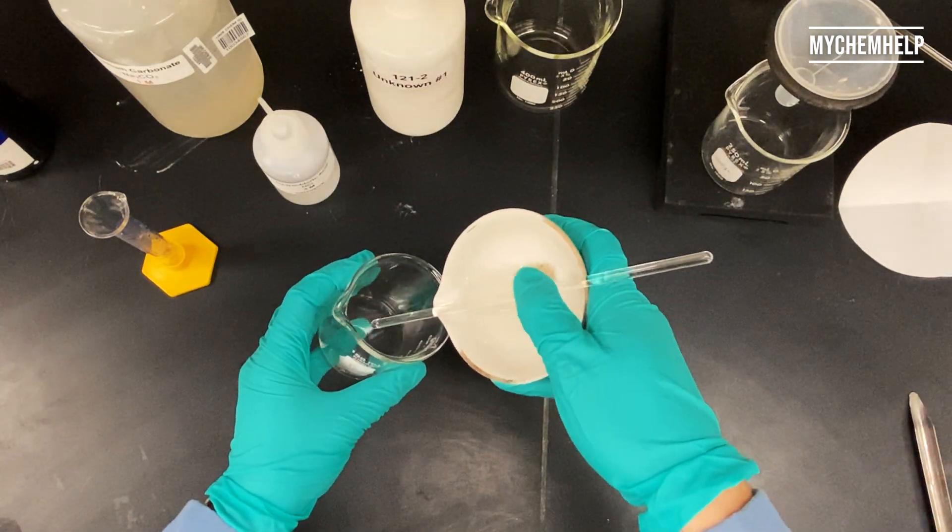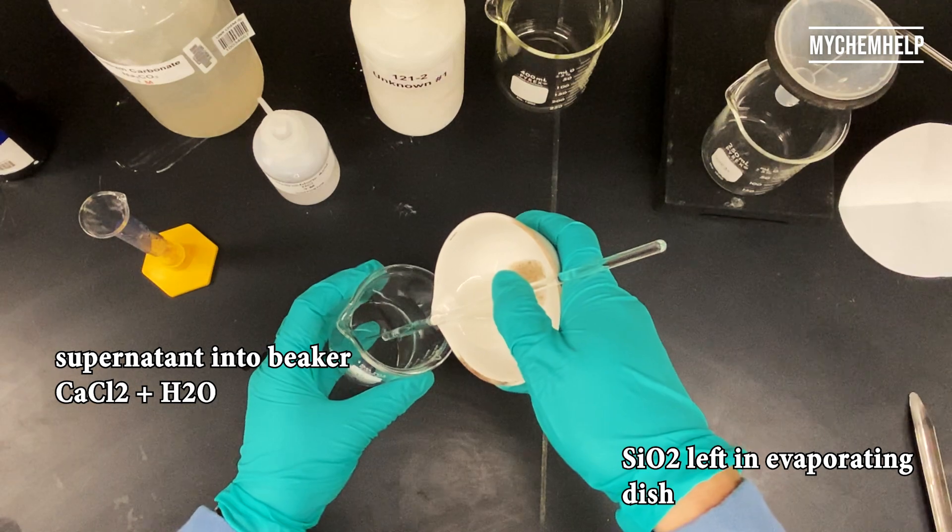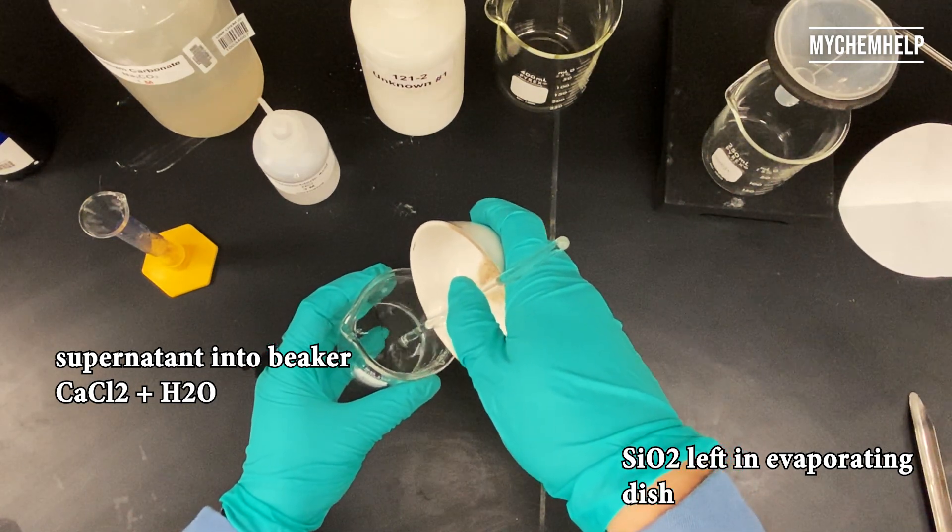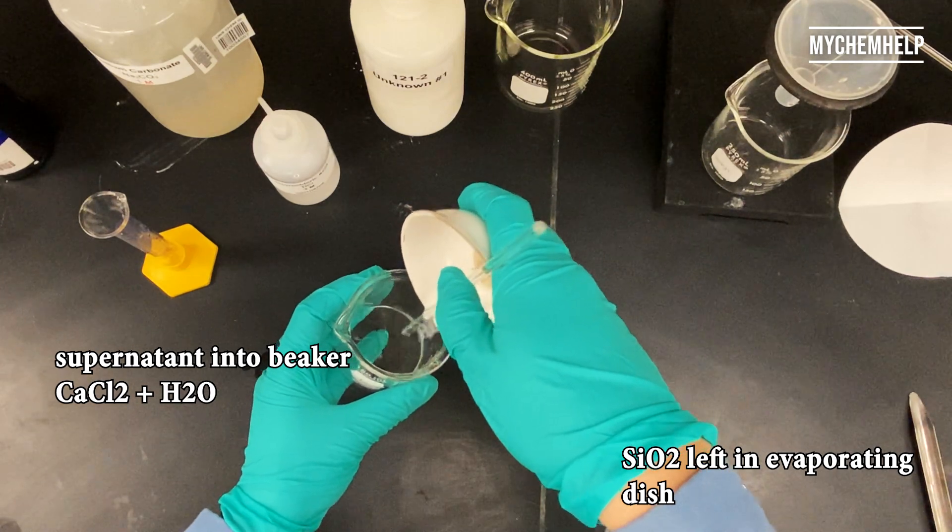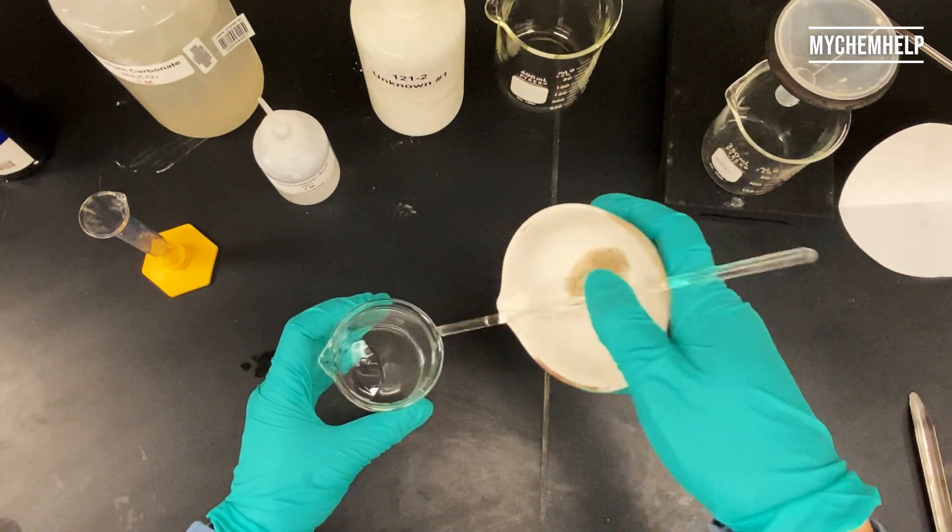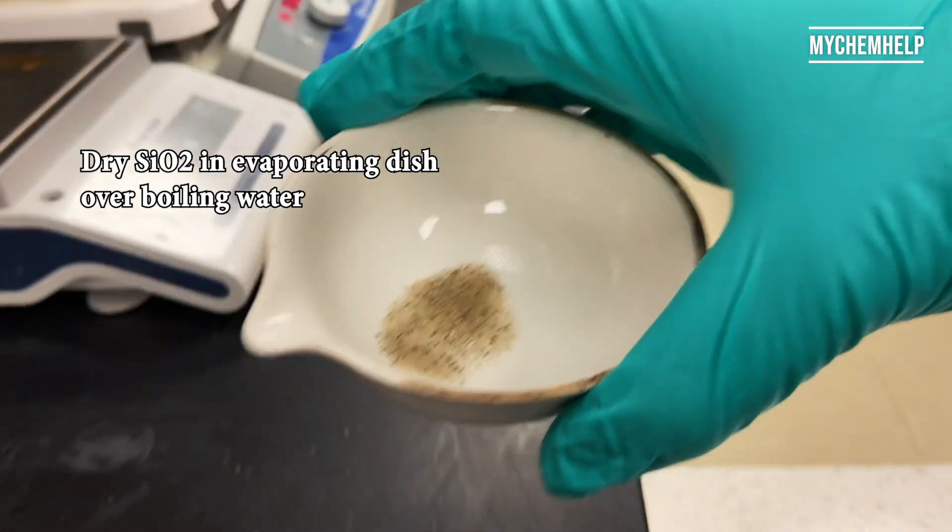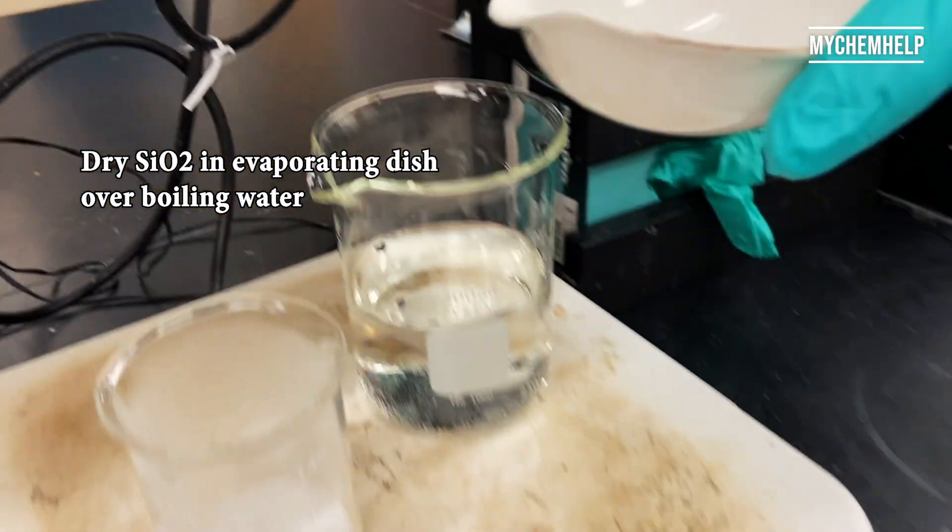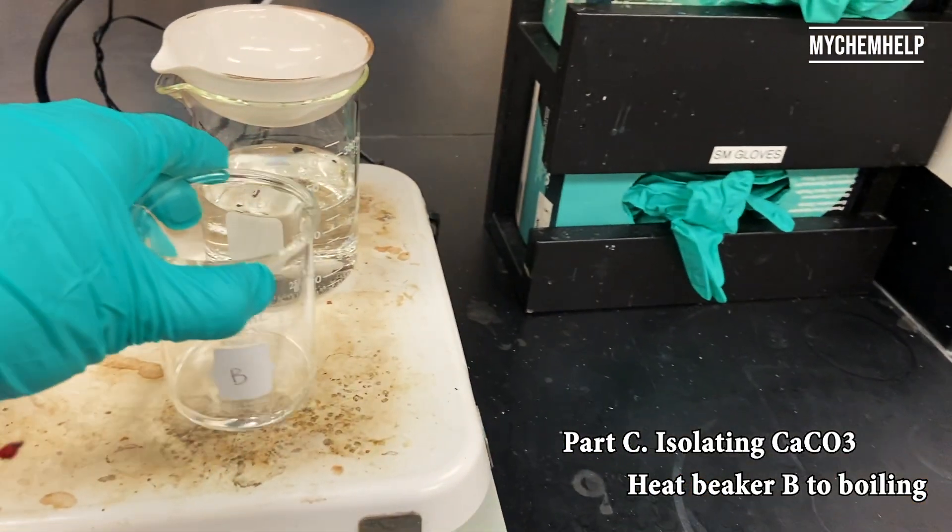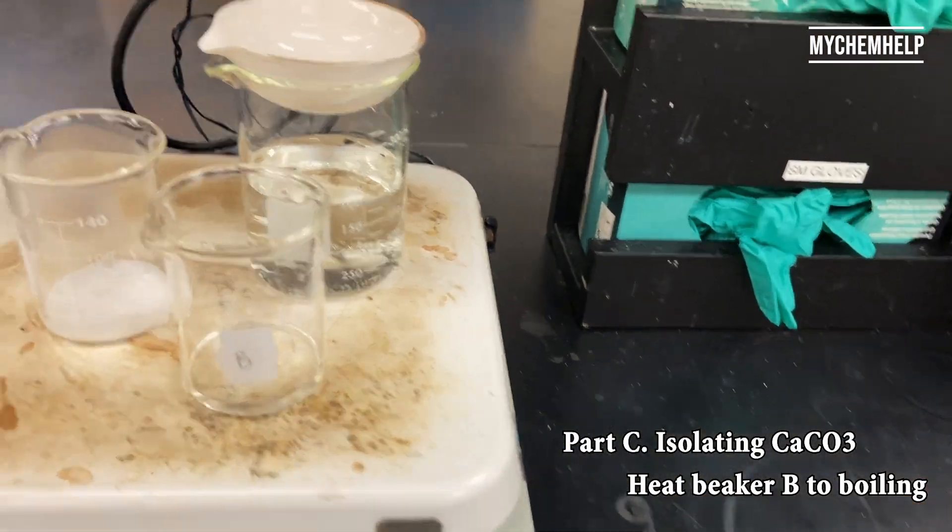And I'm decanting again. It's one of our methods of physical separation. And I'm going to transfer both of these over to our hot plate. I'm going to dry off the sand, and then heat the beaker to boiling.